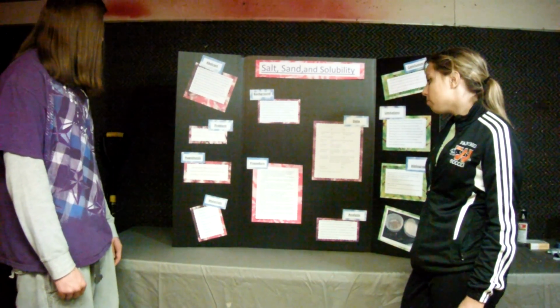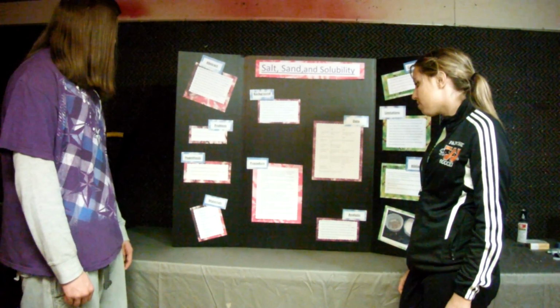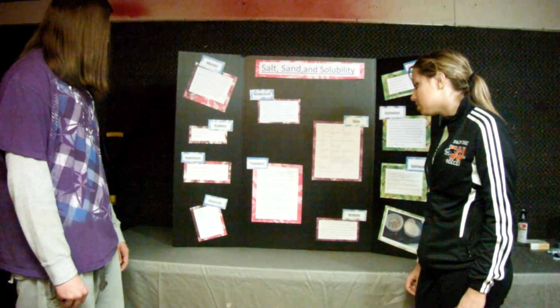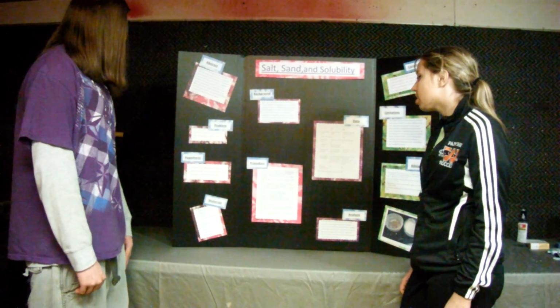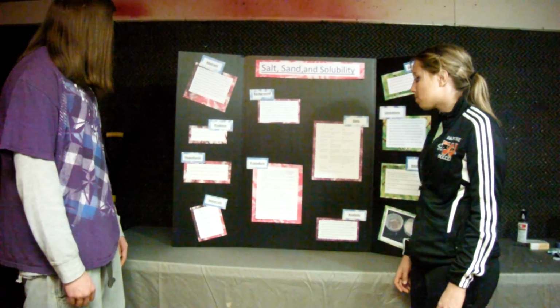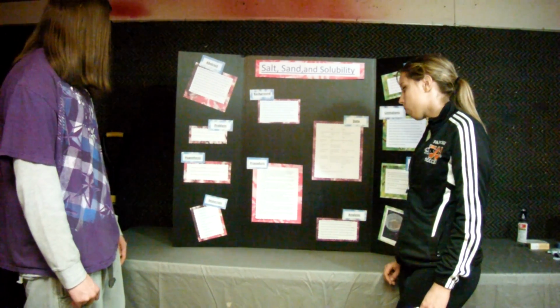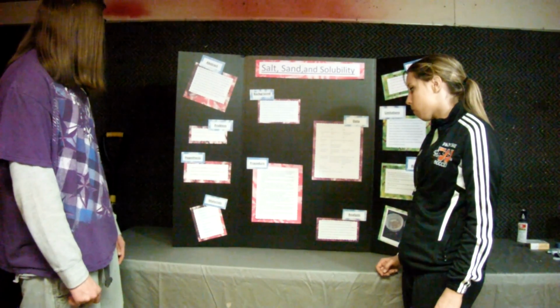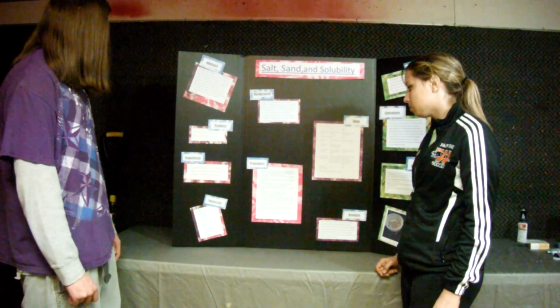After the jars are cooled, use your magnifying lens to make observations of the 2 jars. Can you still see the individual grains of salt and sand? Are they mixed together or separated? Record your observations in your data table. Step 14, now carefully use the scale to measure the amount of salt and sand you ended up with. Do these amounts match the amounts you started with? Why do you think this happened?